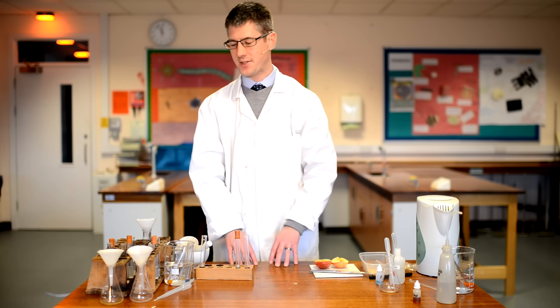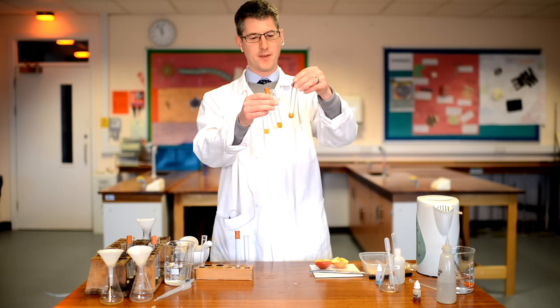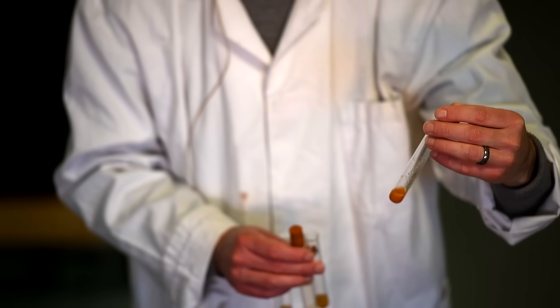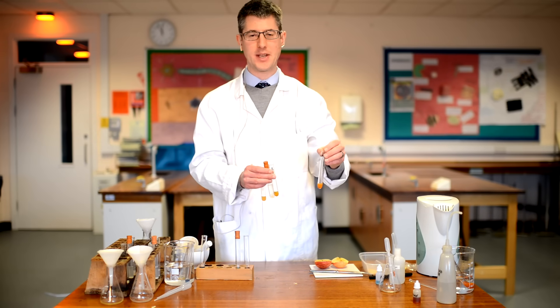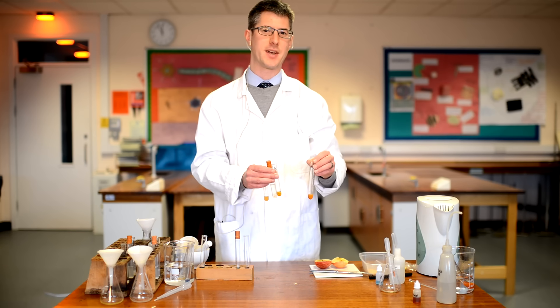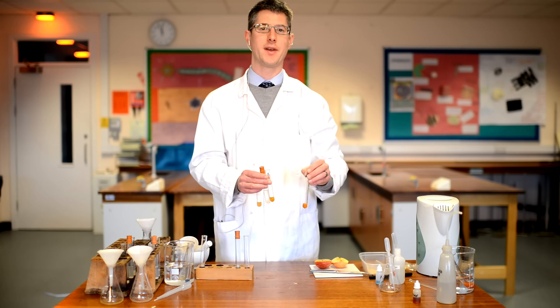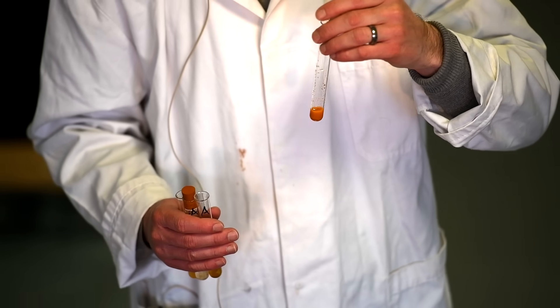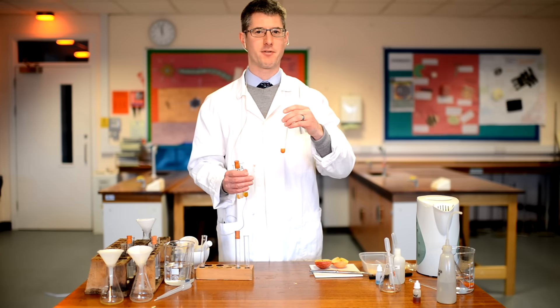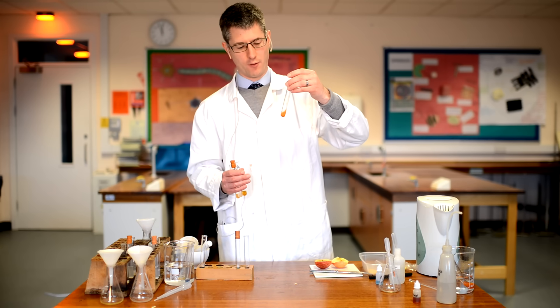I've got my food samples made a bit earlier — I did all these tests earlier and I want to show you the results so you can see the colour changes you should see. These are all for apple samples. The Benedict's test has gone from a blue colour to orange. Benedict's test produces quite an interesting array of colour changes — it starts blue, and if glucose is present you see a sequence of colour changes. The further along the colour change you get, the more sugar you have in your sample. So this can be described as a semi-quantitative test. It goes blue to green to yellow to orange and eventually to brick red, all of which are positive indications of a sugar like glucose. We've got a nice dark orange here, suggesting quite a lot of glucose in our apple.